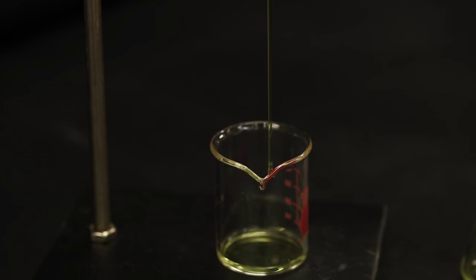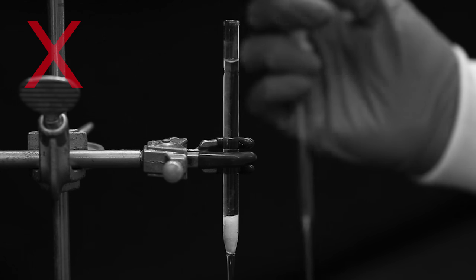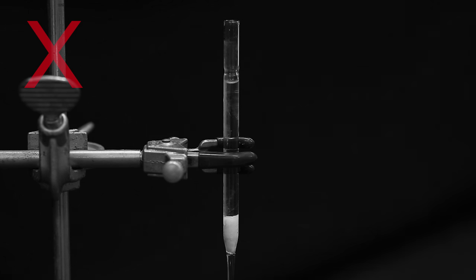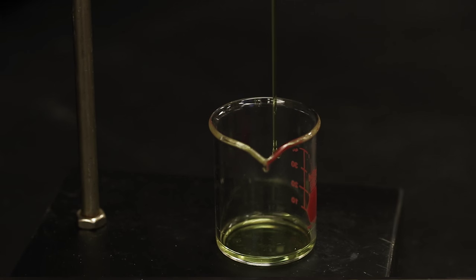While doing this, make sure that the liquid being dispensed is not overflowing. To prevent overflow, pay close attention to the level of the liquid inside the Pasteur pipette filter. This process is complete once all of the liquid has been filtered.